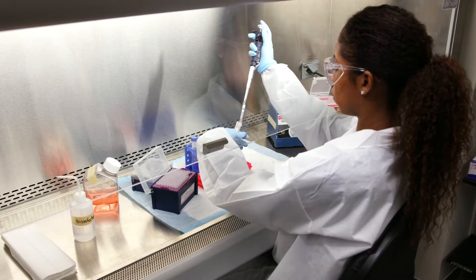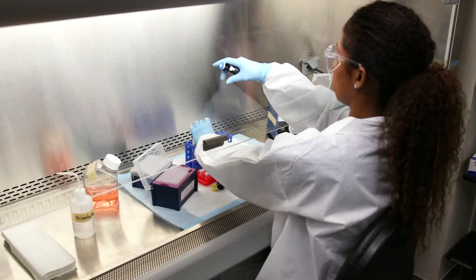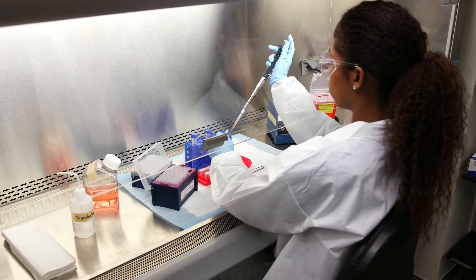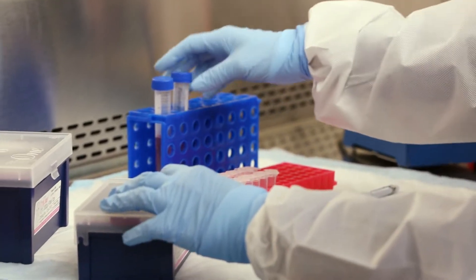Once you have completed your work, you will need to decontaminate all of the materials inside of the BSC and the BSC itself. This is all done while the blower motor is on.